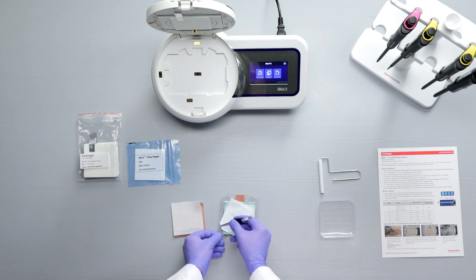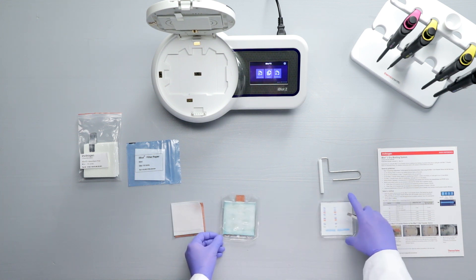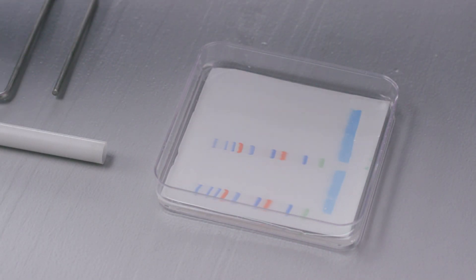Remove the transfer membrane from the stack and either place it in water or blocking solution. The bottom stack can now be discarded. Your membrane is ready for western detection.